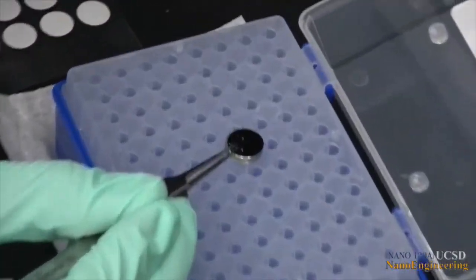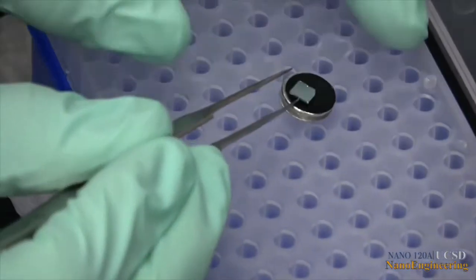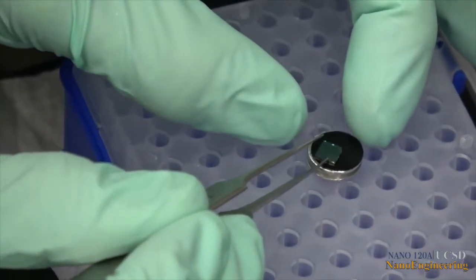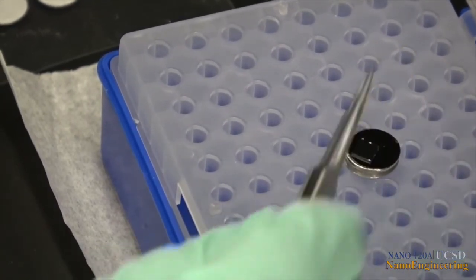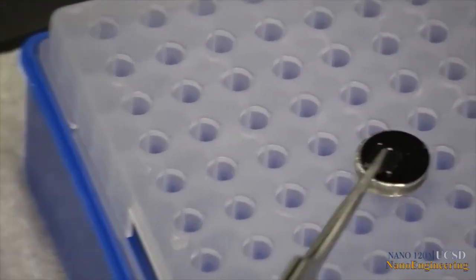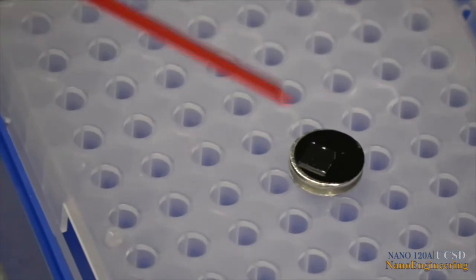The silicon will act as a support for the sample to be analyzed and also provides a good conductive path between the sample and the mount. Dust off the surface of the silicon.